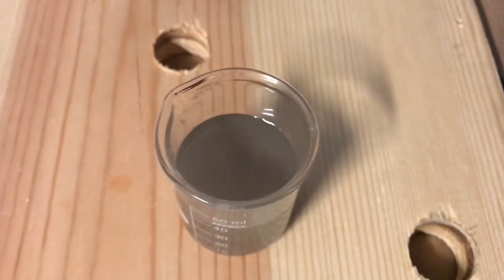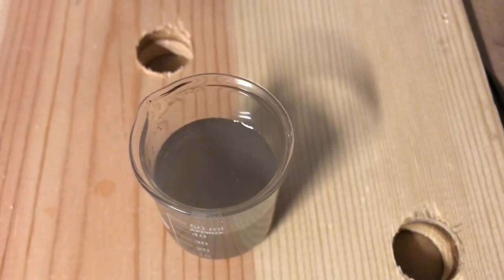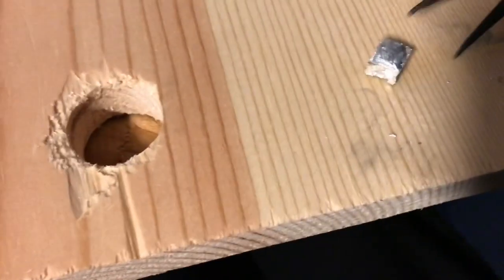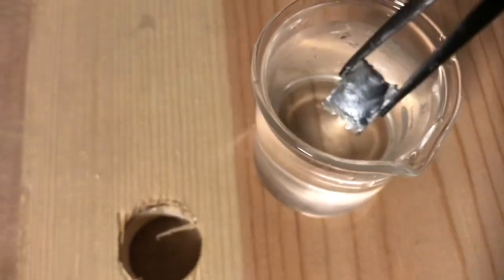Now we're going to do the same thing with a piece of magnesium that we treated with the gallium to see what happens when we put this in water.